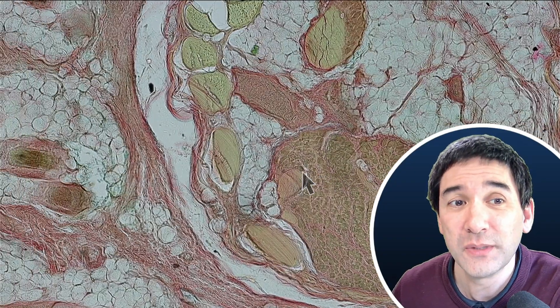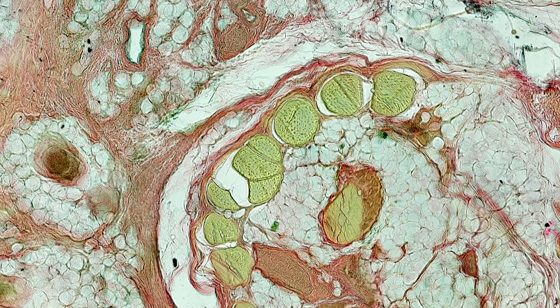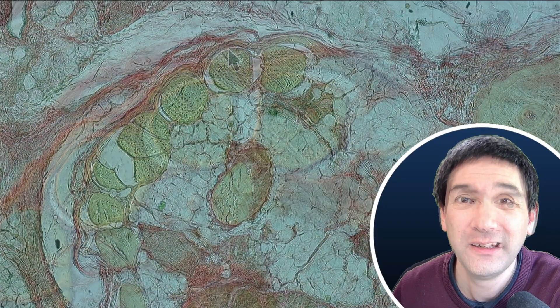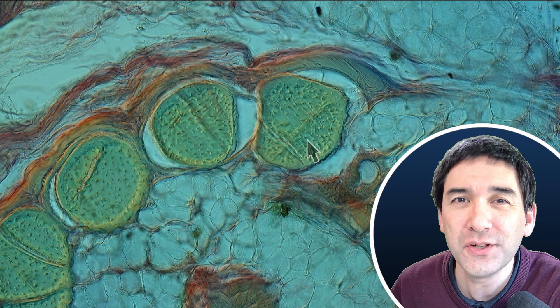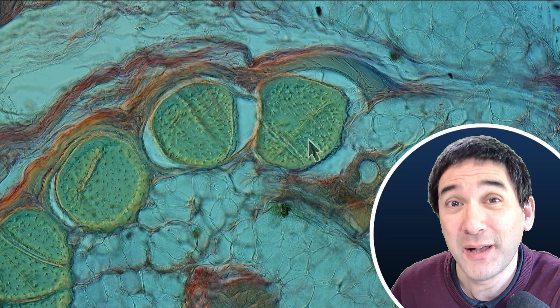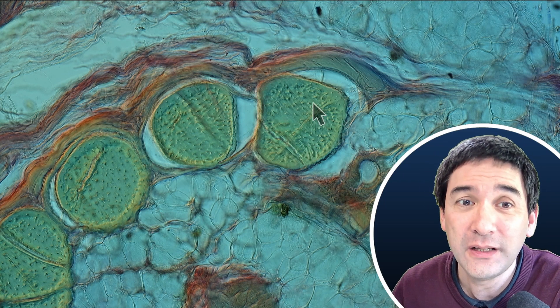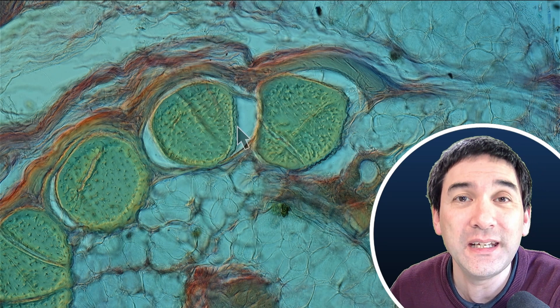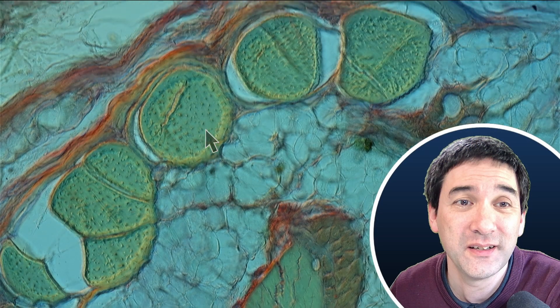Over here, right next to the muscles, there are also these interesting slightly yellowish looking structures. I had some real problems identifying what this is, because normally you do not see them in cross-section, but rather longitudinally cut. These here actually are cross-sections of tendons. The tendons are made of very strong protein fibers and they connect the muscles to the bone. The muscles contract and then they pull on the tendon, and then the tendon pulls on the bone. Those tiny little things that you see in there — almost like spikes — these are actually the individual cells of the tendon.